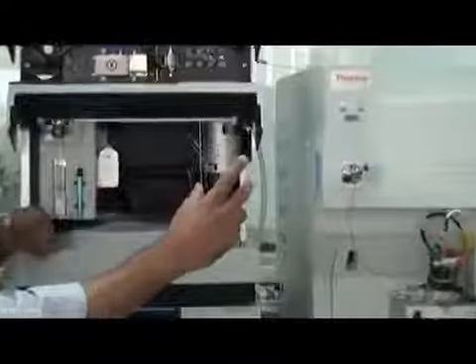When you make an injection, what will happen? There is a needle here. This needle will go to the vial. If you say here in the system that I want to inject 10 microliters, then it will take 10 microliters and inject it here. This will come in the stream of the mobile phase and go to the column. So this injector has two positions, load and inject. When it's on load, it will take and fill the loop, and then it will inject and it comes here.